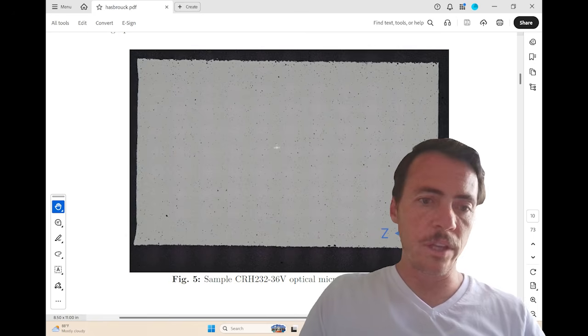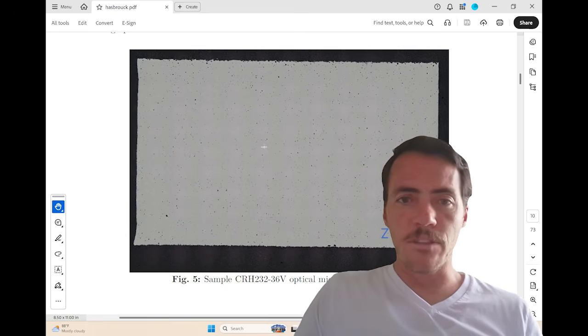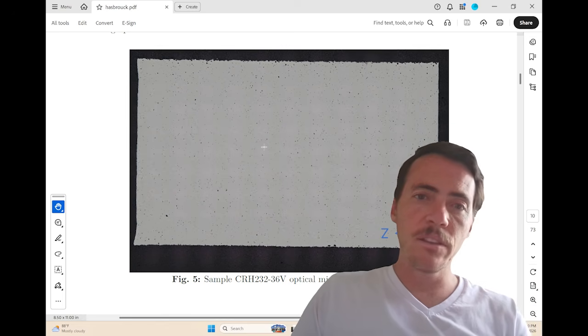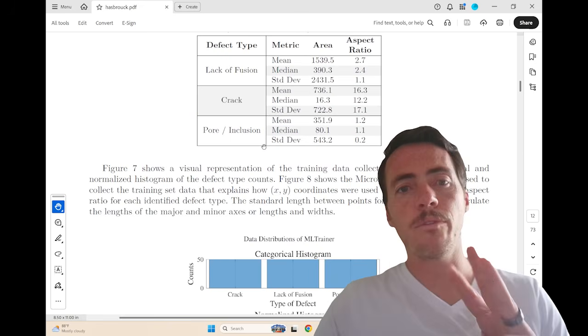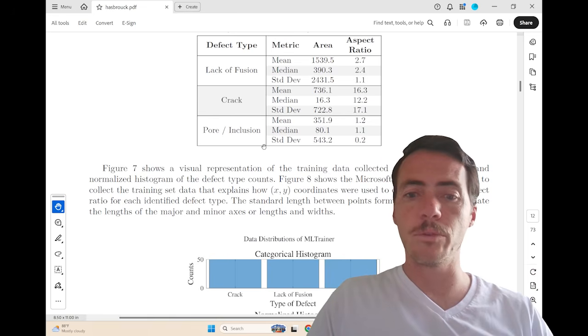Maybe to start with, we can look at this first figure, right? This is showing you an optical micrograph sort of as imaged. And sure enough, you can see a bunch of tiny little defects present in there. But actually, there are different types of defects when you zoom in. Not all these are the exact same. They show here in this table that you have three different types of defects. You've got lack of fusion, you have cracks, and then you've got your pores or inclusions.